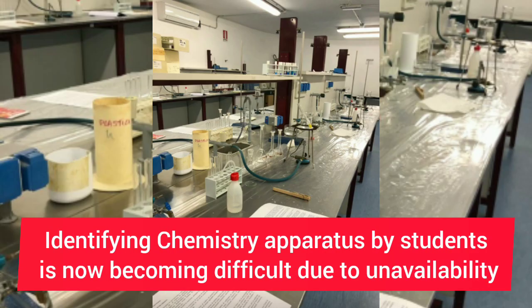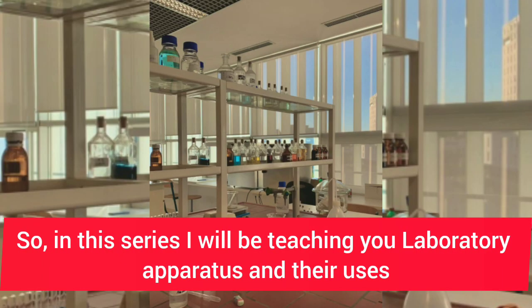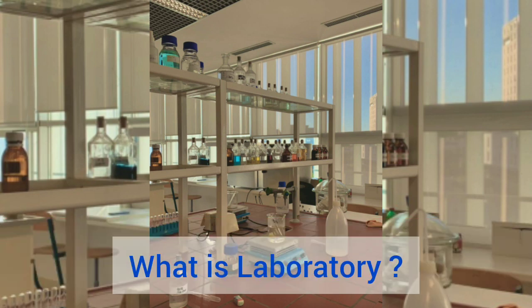Identifying chemistry apparatus by students is now becoming difficult due to unavailability. So in this series, I'll be teaching you laboratory apparatus and their uses. First and foremost, what is a laboratory?